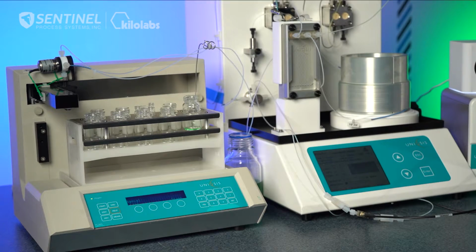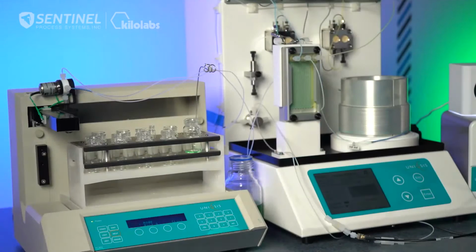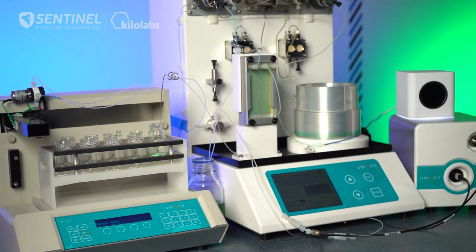Here the solvent is going, the reagents are going through the mixing chip. And as you can see, the green color is now in the mixing chip and is now starting to enter the coil. And as it exits the coil and goes through the flow cell, we'll be able to see the signature on the bottom screen here.